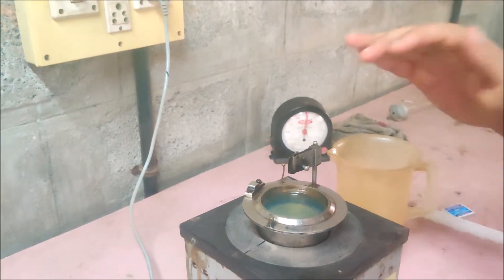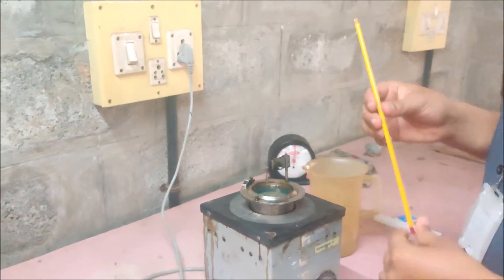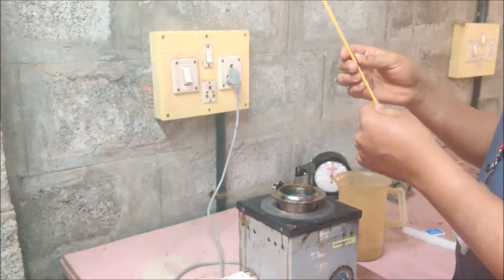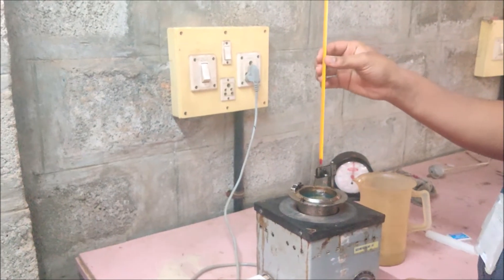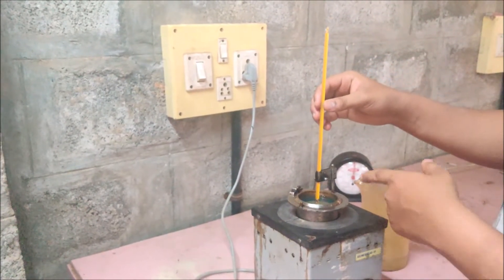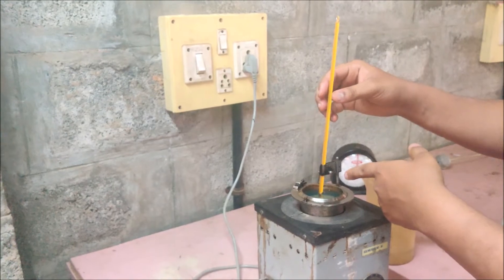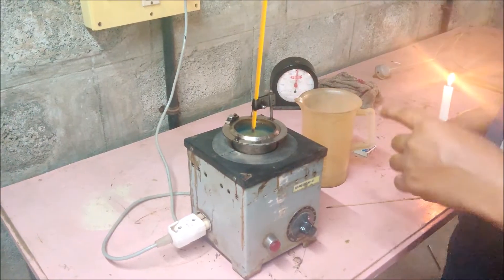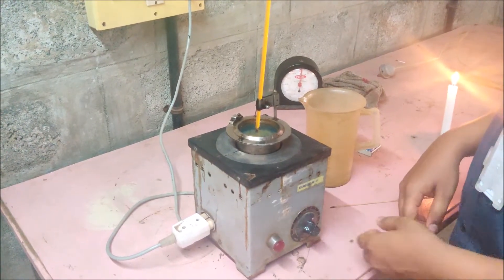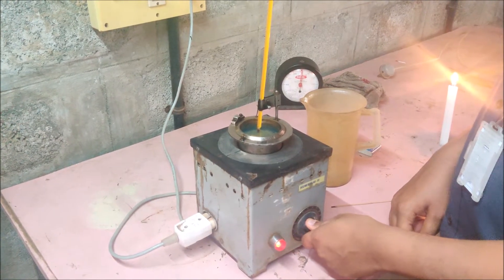So now the oil is in the apparatus. We have to place a thermometer to take the readings. While you place the thermometer, make sure that the thermometer is not touching the bottom. So now the apparatus is plugged in, and let's turn on the heater. So now the heater is on.